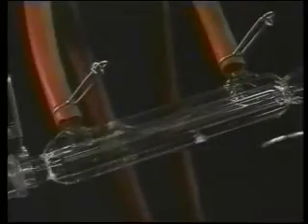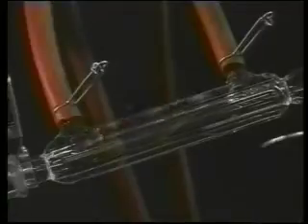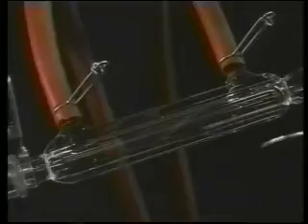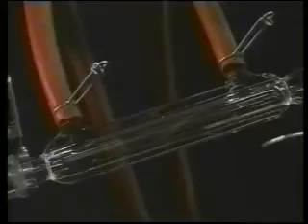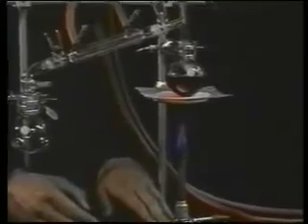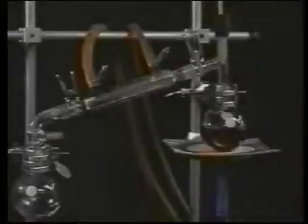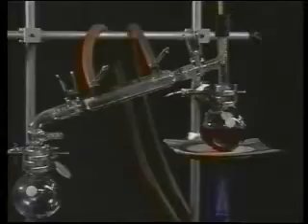Start your distillation by adjusting the water flow through the condenser to a modest flow rate. No benefit is gained from a fast flow, as the increased pressure in the apparatus may cause a piece of rubber tubing to pop off and cause an unexpected bath. It is good practice to clamp the hoses to the condenser and to the water faucet. Apply heat at such a rate that the liquid begins to boil gently and the reflux ring of condensing vapor rises slowly into the still head.